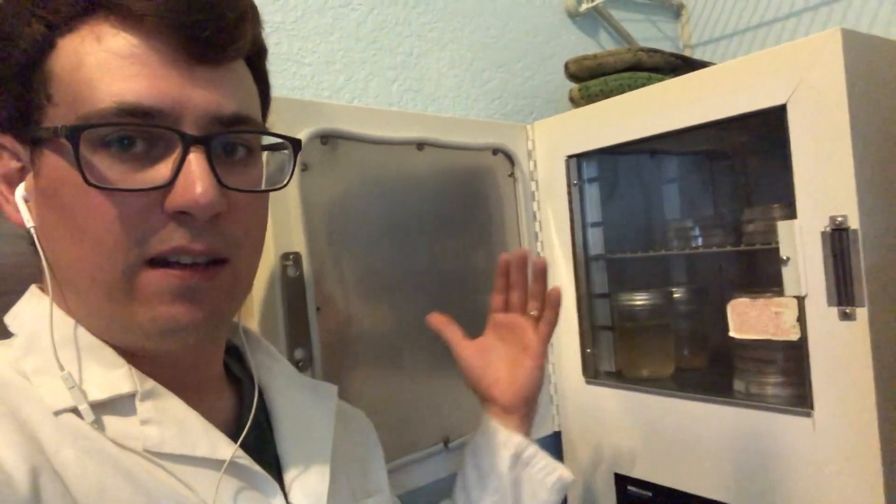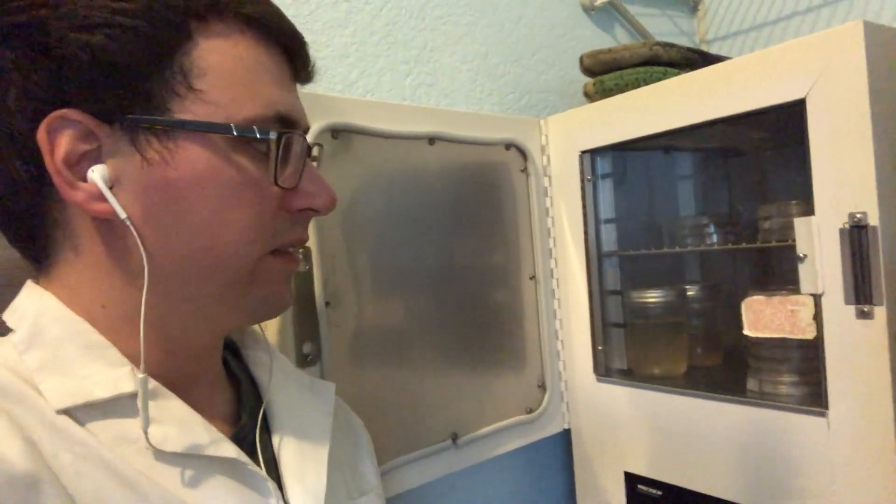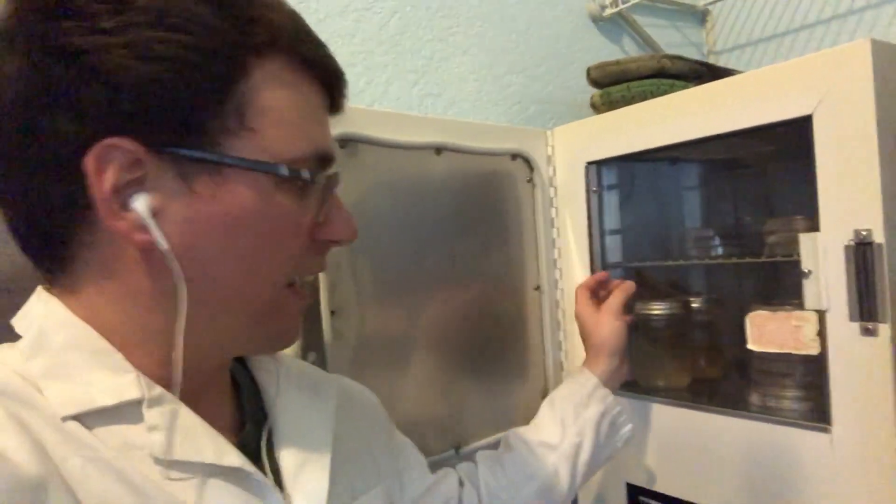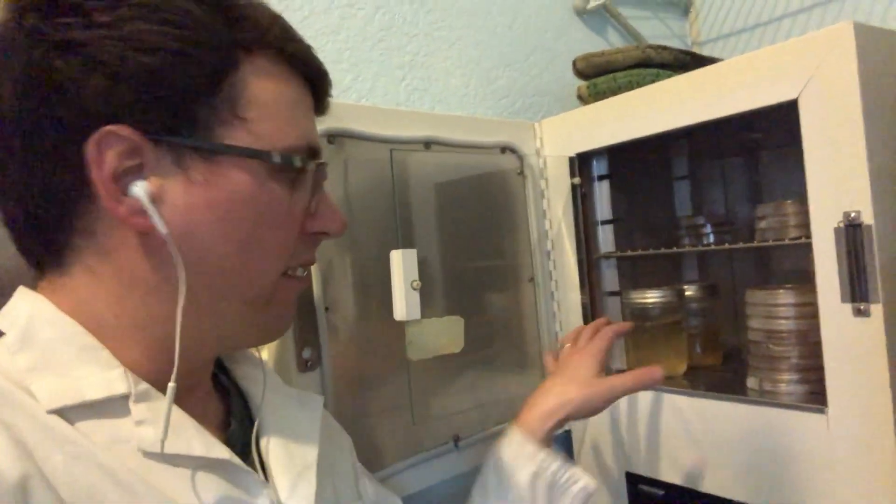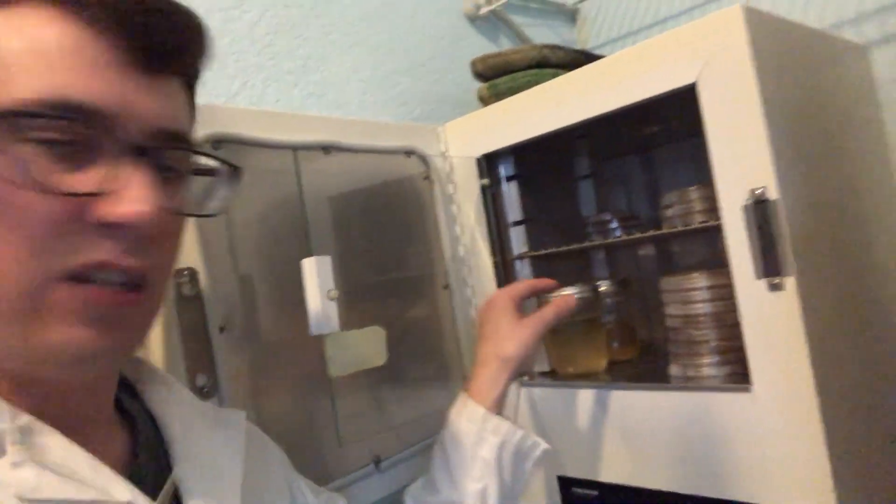And it doesn't cause temperature swings, which some mycelium can be really sensitive to temperature swings, or you can start to see concentric growth. But this glass is just another layer of protection. So then I'll go into this and this is how I stack all my plates upside down. So any condensation goes to the bottom.